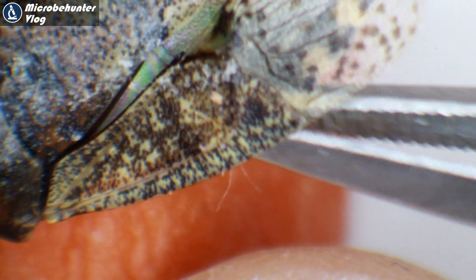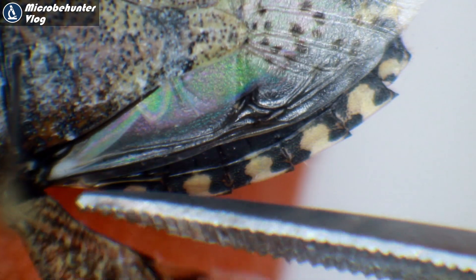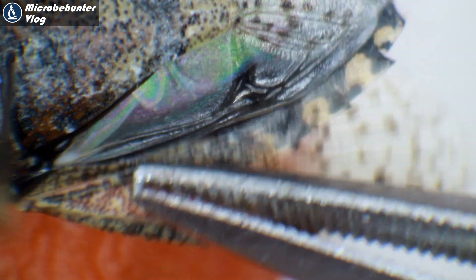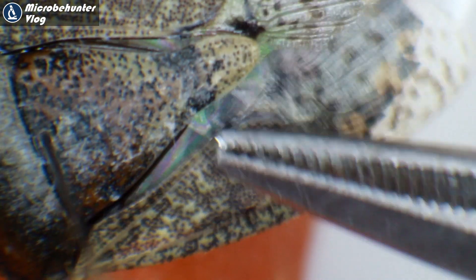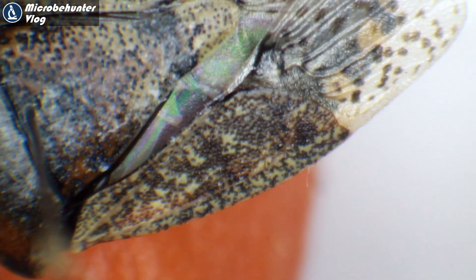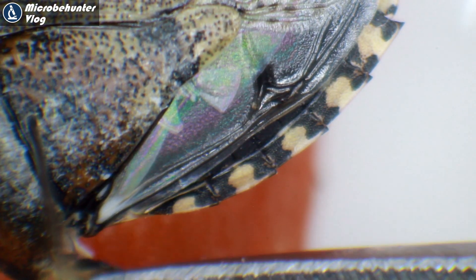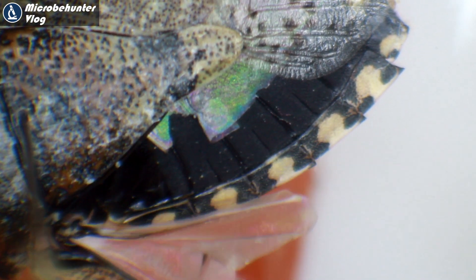I'm trying to separate the wing using my tweezers, which isn't easy because it always snaps back. When you lift the top wing a little, you can see the second pair of wings beneath it — completely membranous, very soft and transparent. It keeps snapping back, showing how strong the muscles of this bug are; moving it forward stretches those muscles. Here we have the second pair of wings, which I'm now pulling out.